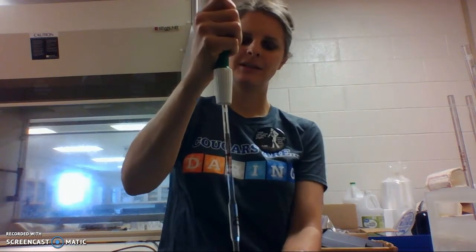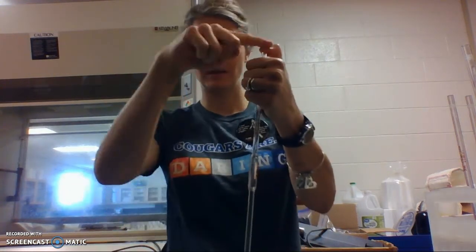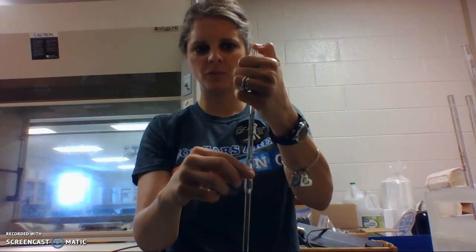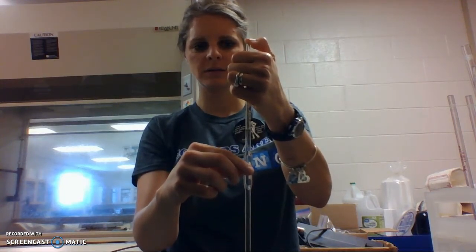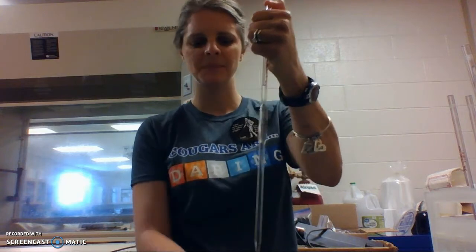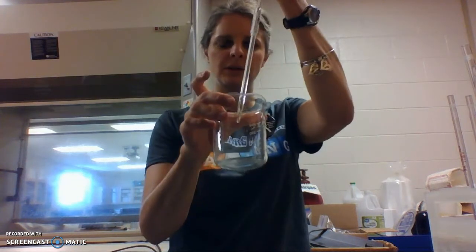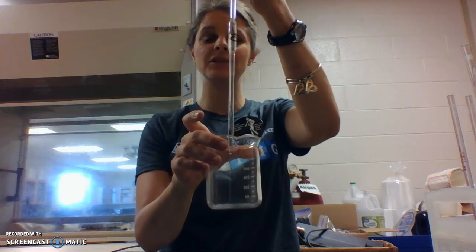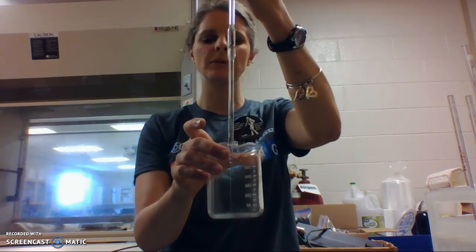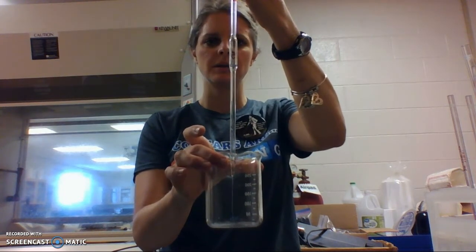Sometimes the seal isn't very good, and in case that happens you have to be like a ninja. You can see I've put my thumb on top of this, and I can roll my thumb away, kind of like a straw, until it gets exactly to the line that I want. There we go, it's right at the line. Now I'm going to put it in the other beaker that I want to transfer it to. Now remember, this one is called a TD, that means to deliver. That means the pipette will deliver it for you.